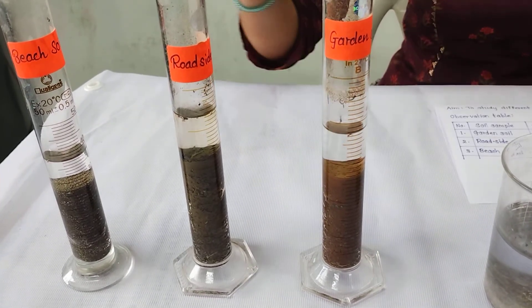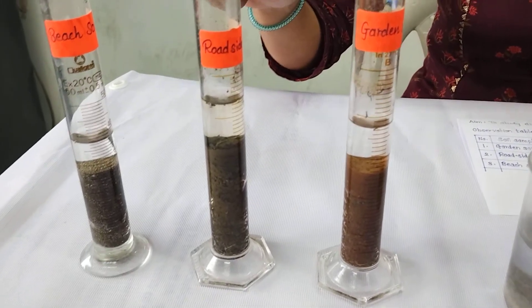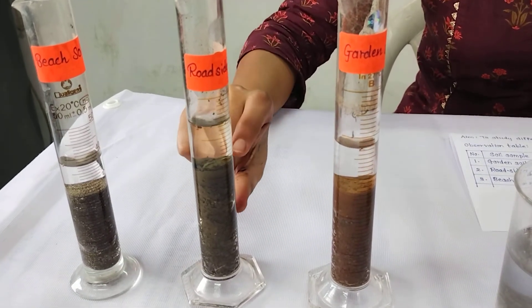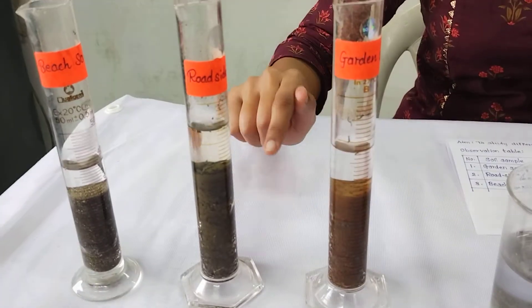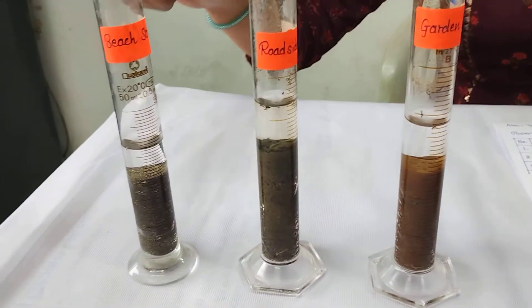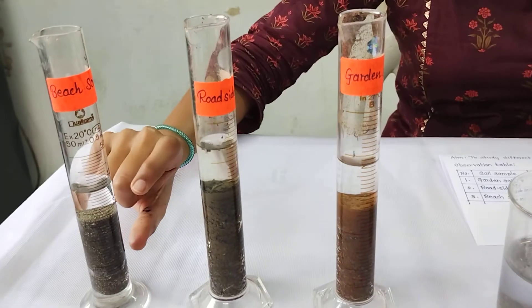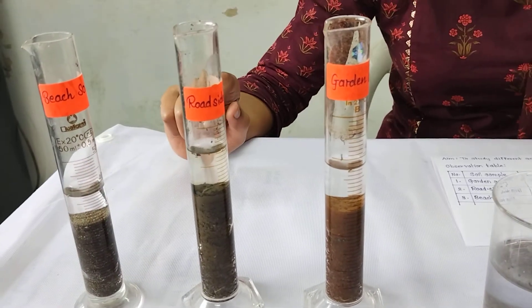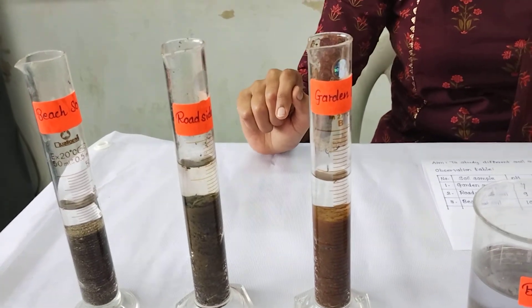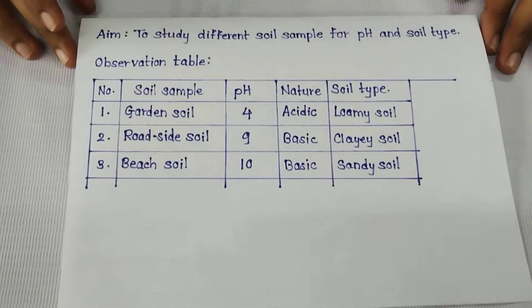In the second sample, that is roadside soil, we can observe that the amount of clay is more than 80%, so that's why roadside soil is clayey soil. In the last sample, that is beach soil, we can observe that the amount of sand is more than 80%, that's why beach soil is always sandy soil.